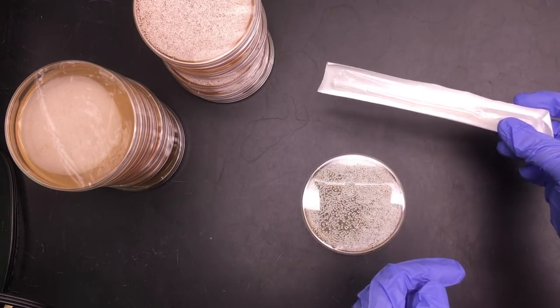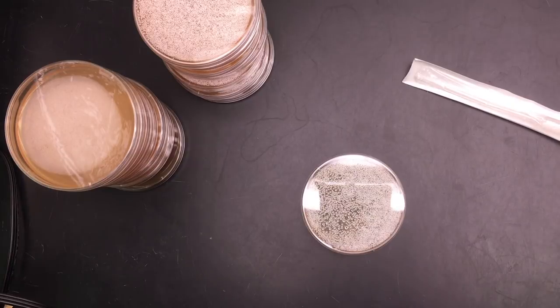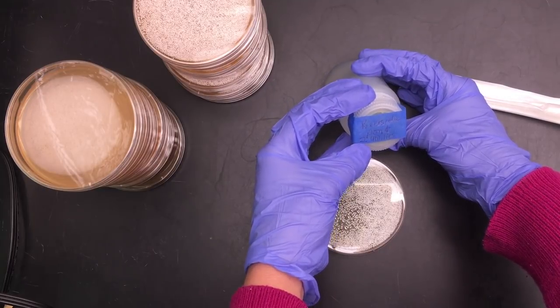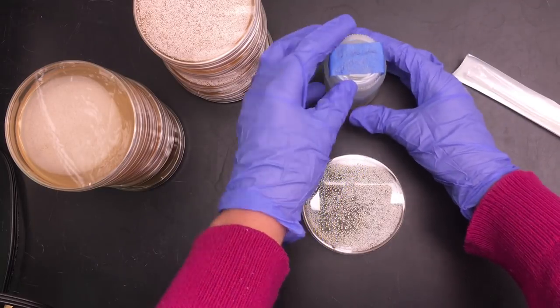So first I need a sterile pipette and I need a water sample. I'm going to go ahead and take this water sample here. This water sample is from a pond that was in Riverside, California.